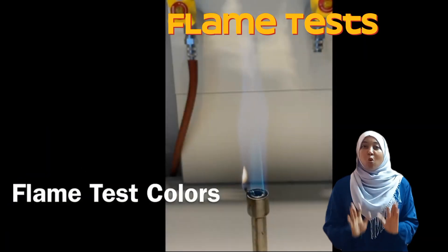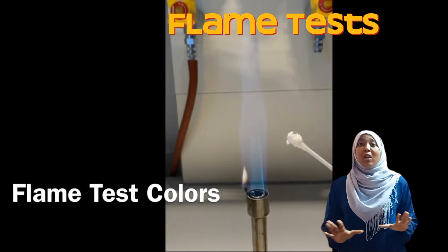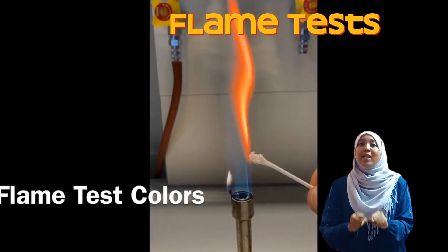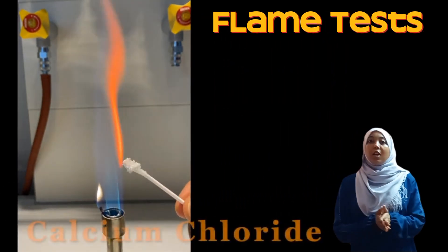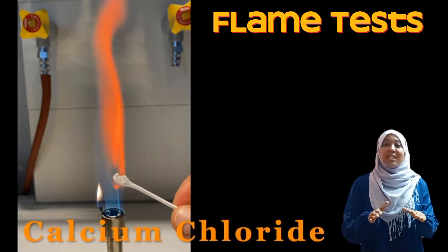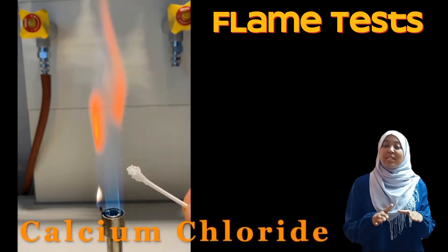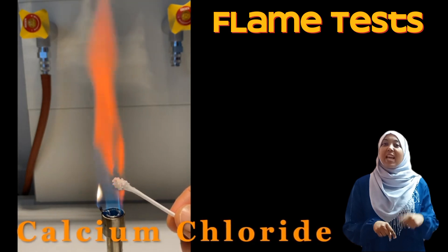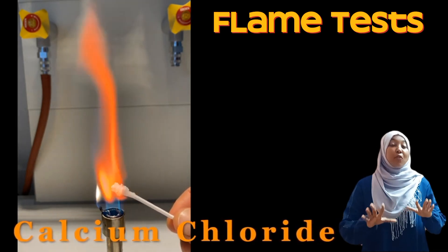Now let's watch this beautiful array of colors that is emitted when certain metallic compounds are heated. Our first one: calcium. The color emitted when you burn calcium compounds is an orange-yellow flame.